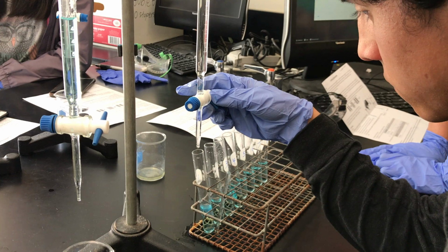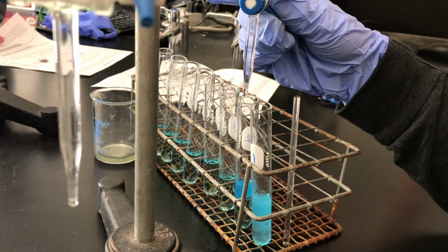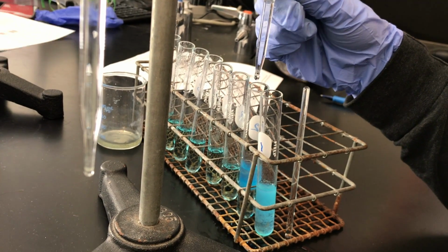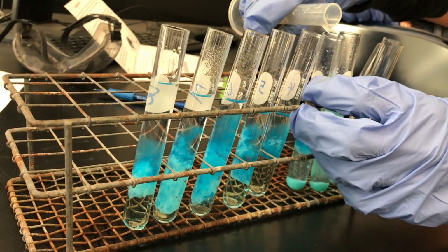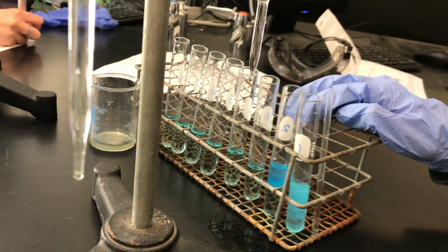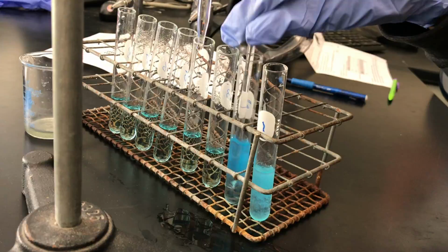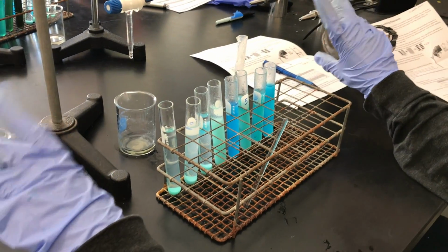We began by filling each test tube with 5 ml of copper sulfate, and we increased the amount of potassium hydroxide by 1 ml for each test tube until we ended up with 8 ml on the 8th test tube. We then added the appropriate amount of distilled water to have each test tube with 13 ml of solution. After having the appropriate amount of solution, we used the glass stirring rod to stir the solution and let it settle for 15 minutes.